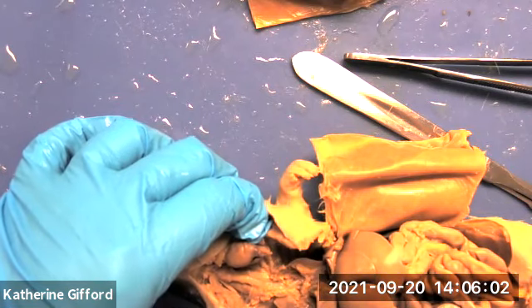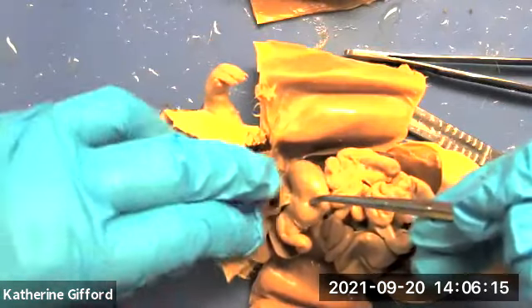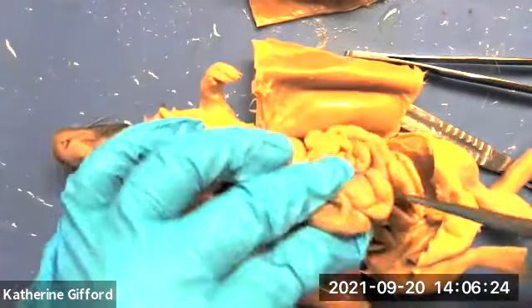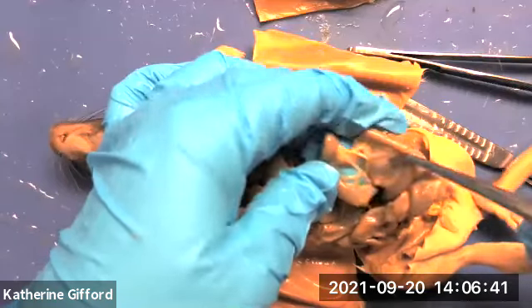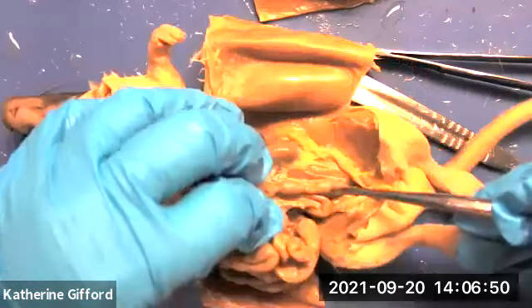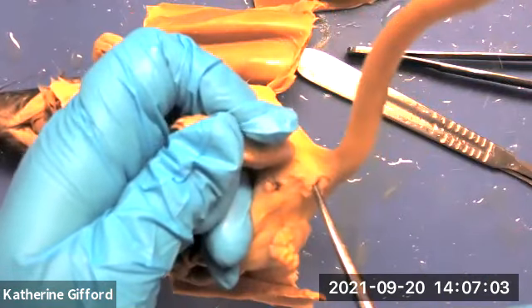The esophagus passes behind the lungs, goes through the diaphragm, and into the stomach. You can see the body of the stomach, pyloric stomach, and duodenum. Again, the cecum is going to be a big pouch somewhere in the middle — it'll have a smaller tube going in and that's the ileum. You have the mesentery and then the rest of the colon. If we roll things over you can see the descending colon. Again, the anus is going to be at the base of the tail.